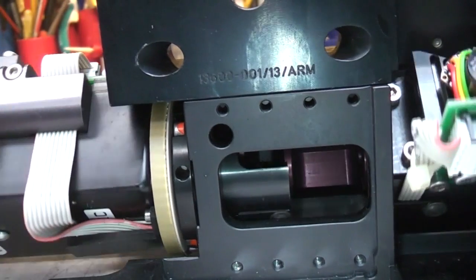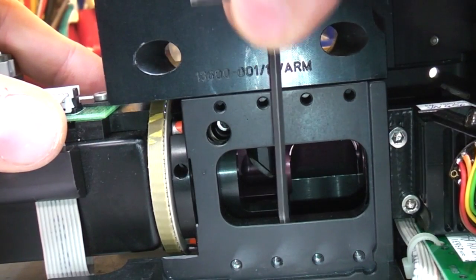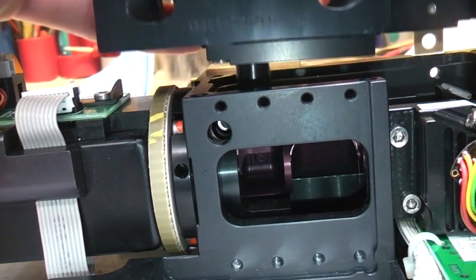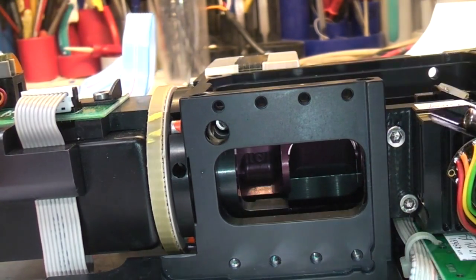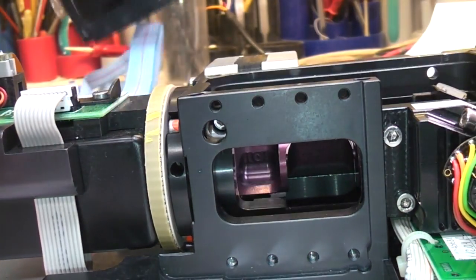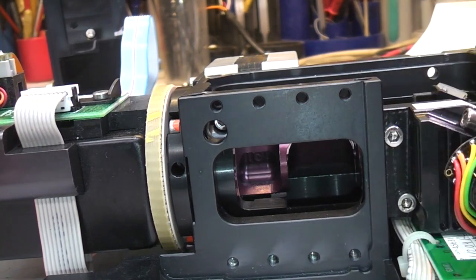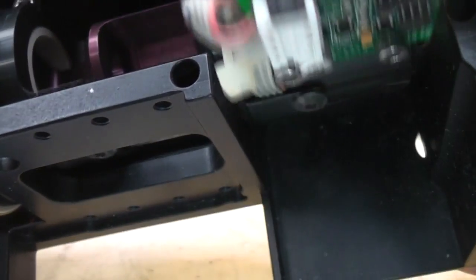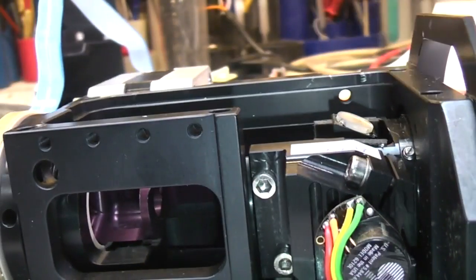Okay, now down to this rotating part. Now the light path here, this is sort of the downward path. So this comes down and gets reflected to the right by this little mirror here. So this is now sort of going horizontally that way. I think I'm going to have to take this a bit further apart to see exactly what's going on. There's a few sort of couple of mirrors up here and something going on here. So I need to, I think, get a bit further into this to figure out what happens next.